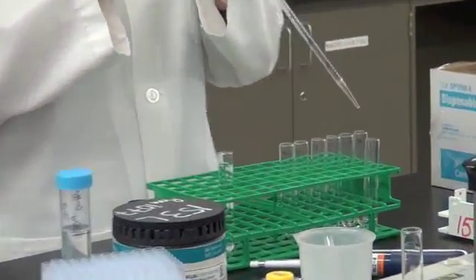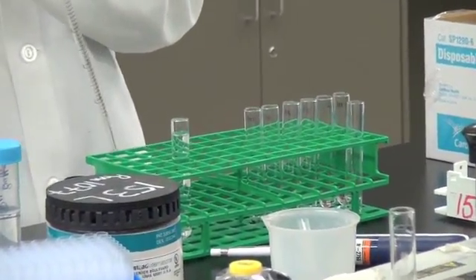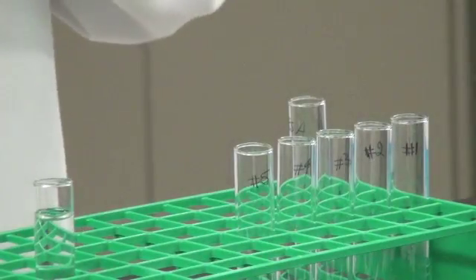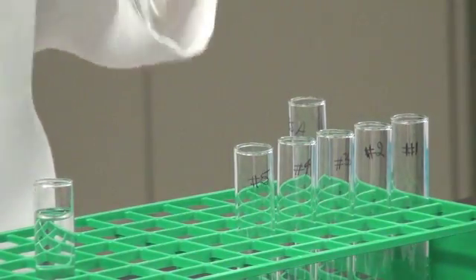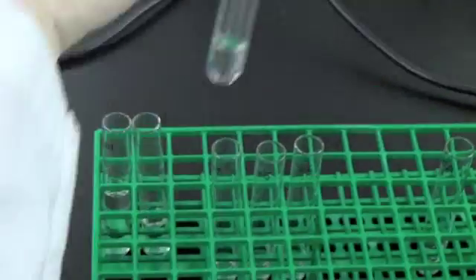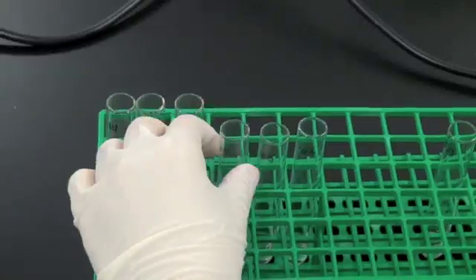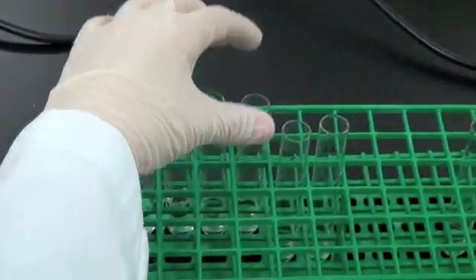Before you start, be sure to have an organized rack and bench space. Also have a plan as to how you will lay out your samples in your rack. One way to use a rack in keeping track of your progress is to move tubes to another row each time that you add a particular reagent.